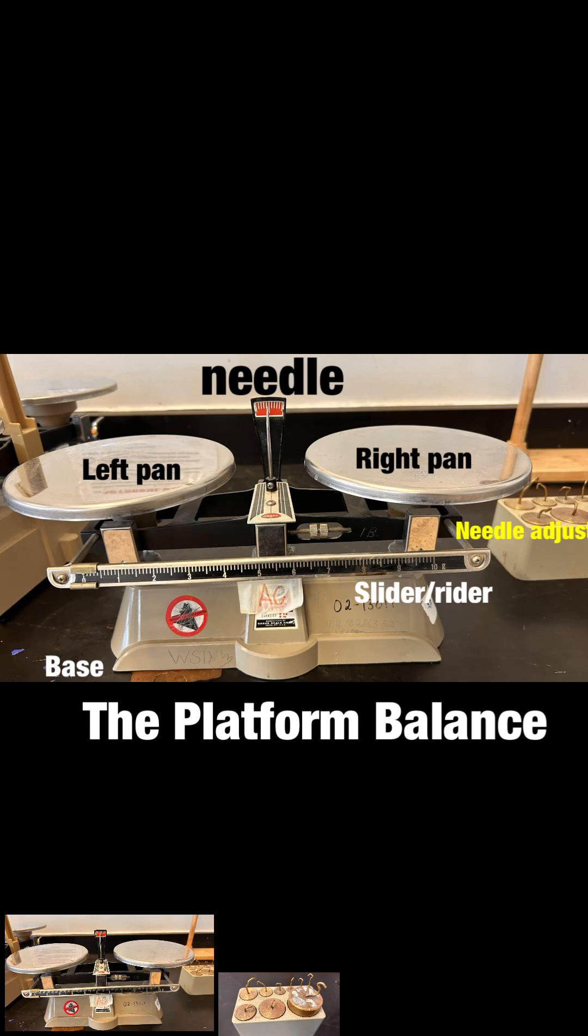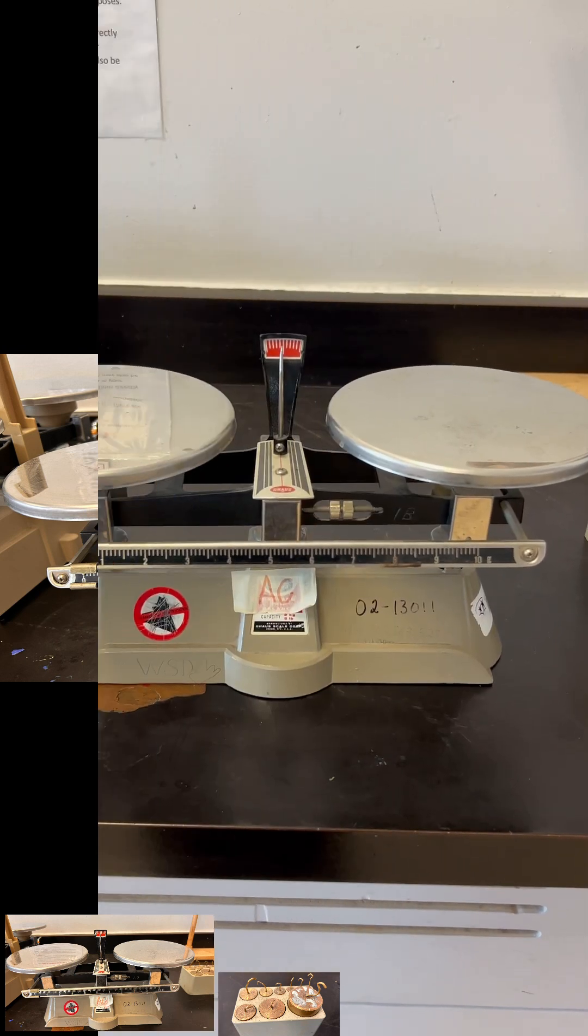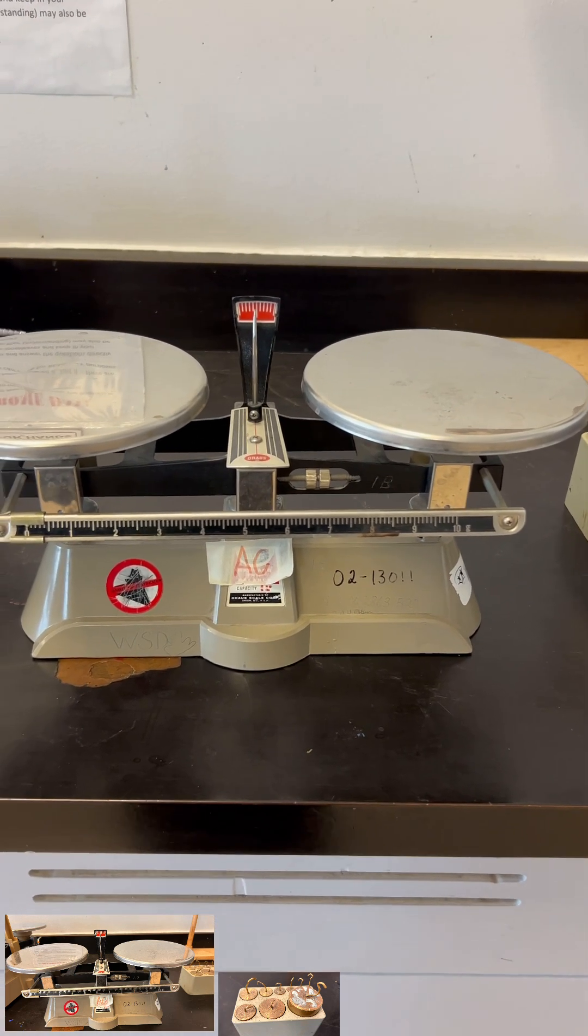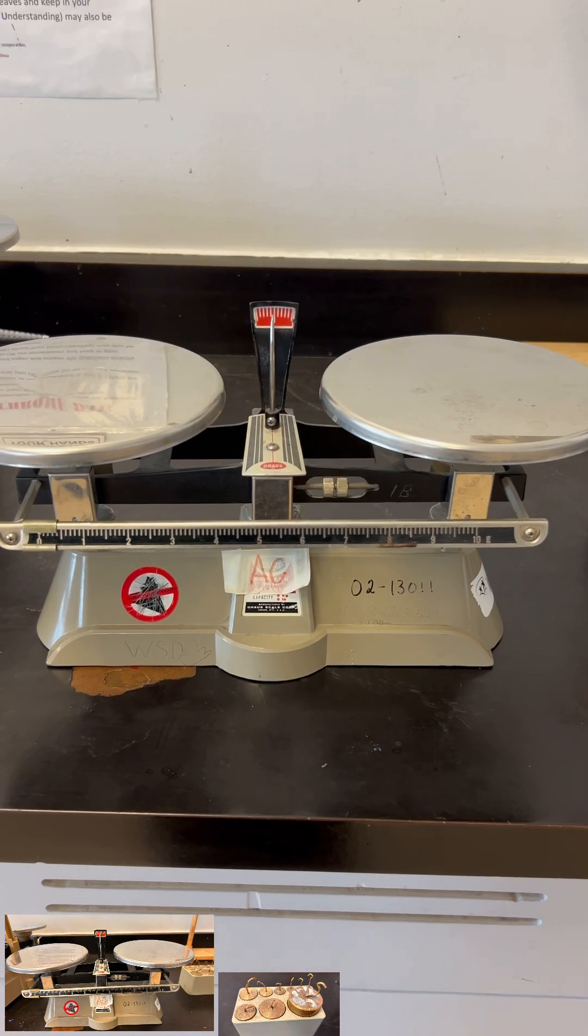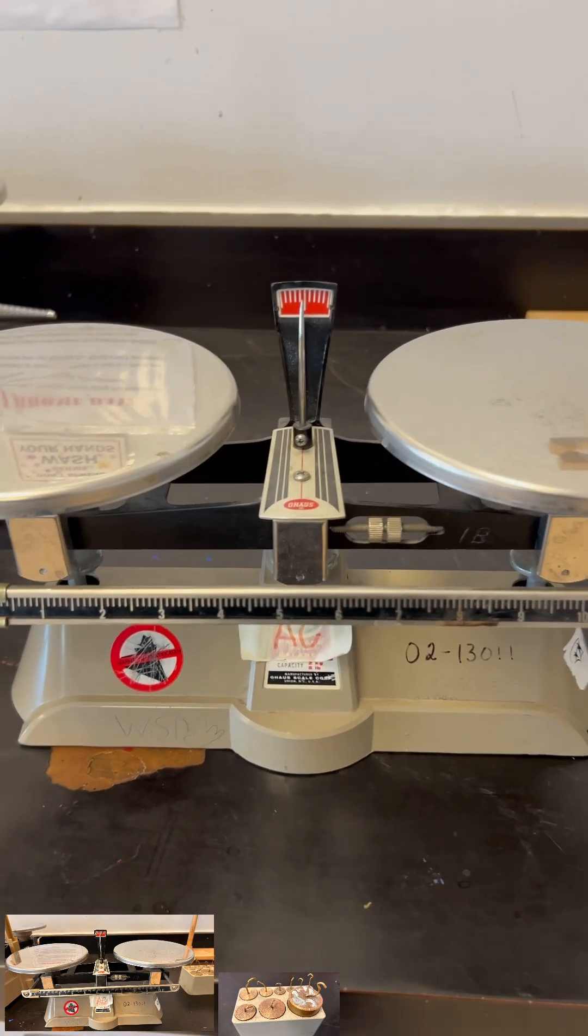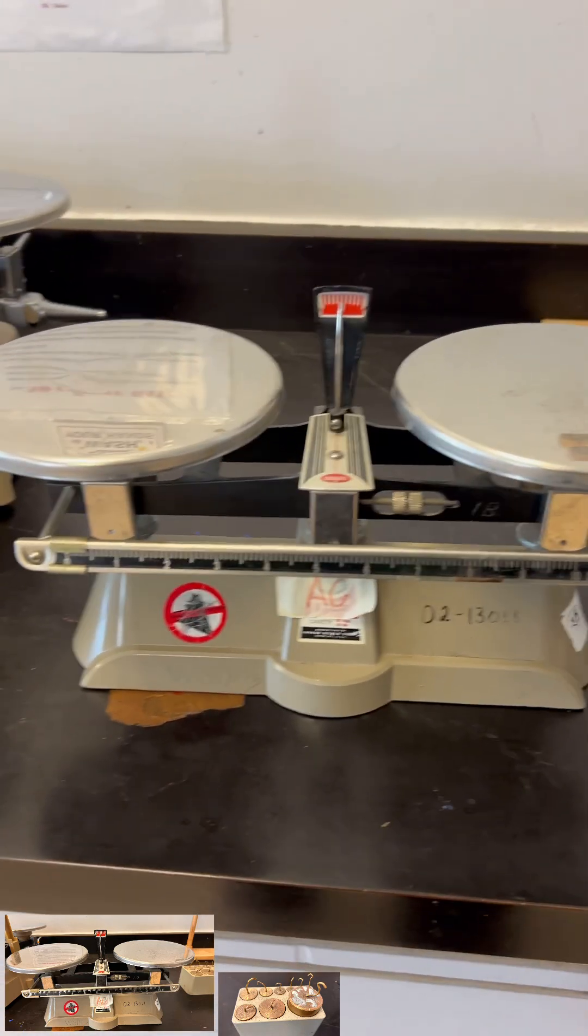Hi there Falcons, welcome to room 311. One important laboratory skill is how to measure the weight of something, and this is a platform balance. We have quite a few in the room. Now let's deal first with the parts of this platform balance.